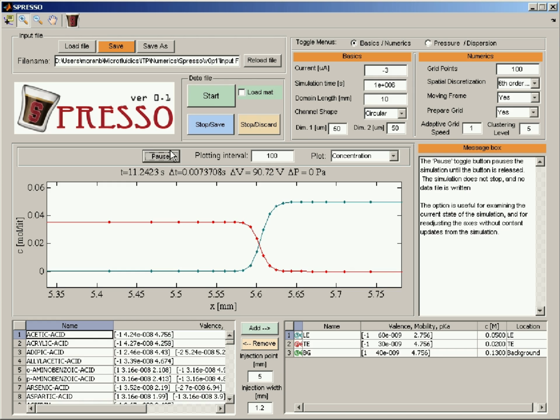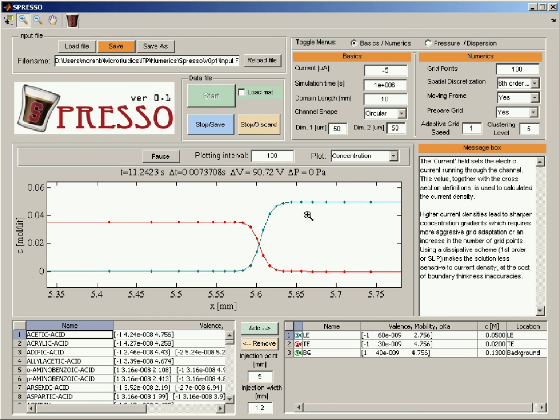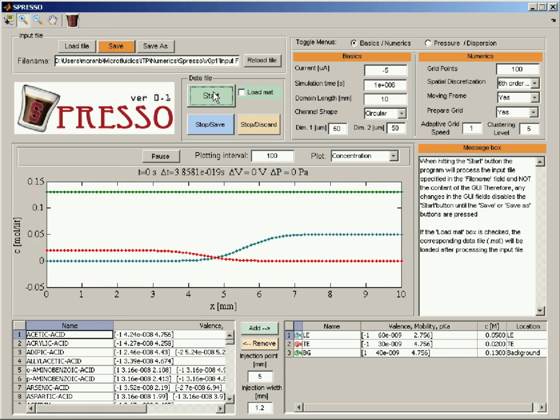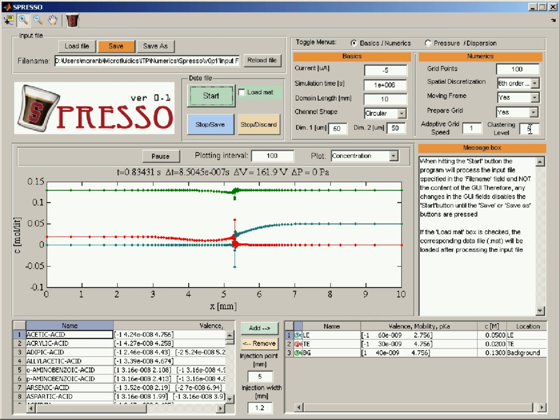So stop this. What happens if we go to higher values? So let's go for 5 microamps. Zoom out here. Save and start. This is now even sharper. It should be a 20 micron interface, and this value of 5 is no longer enough. So we stop, and now we don't have a choice but to increase the number of grid points.